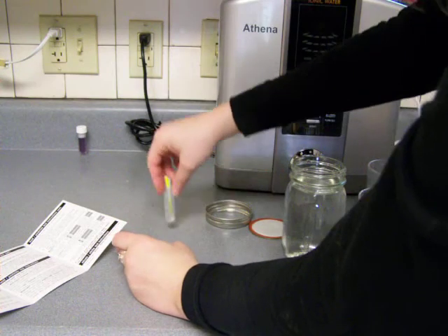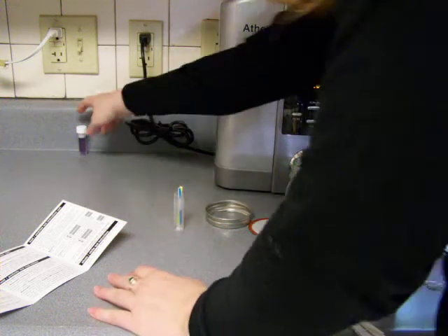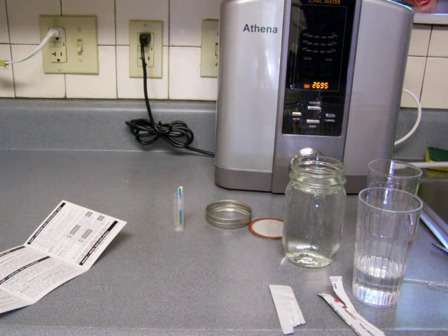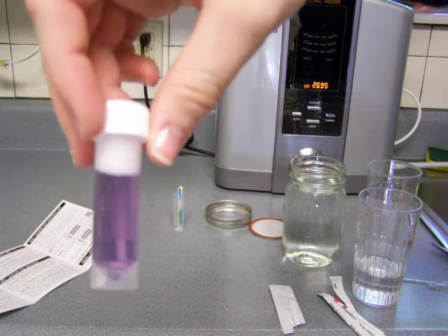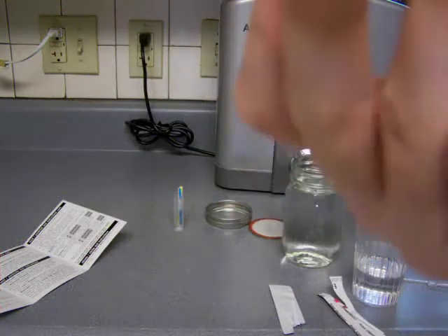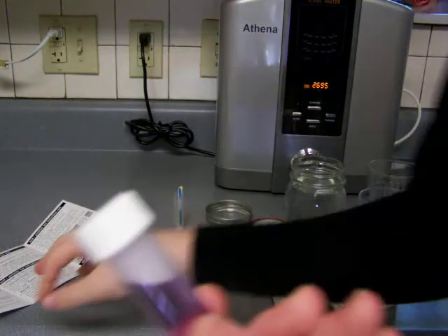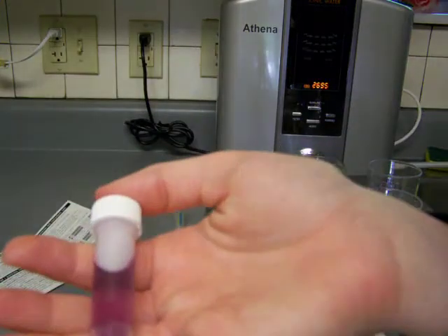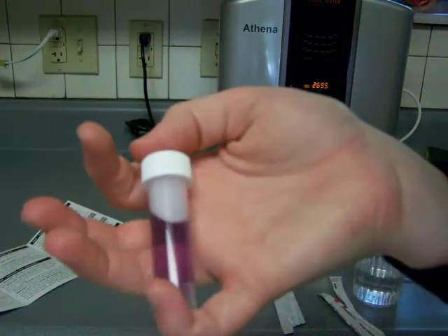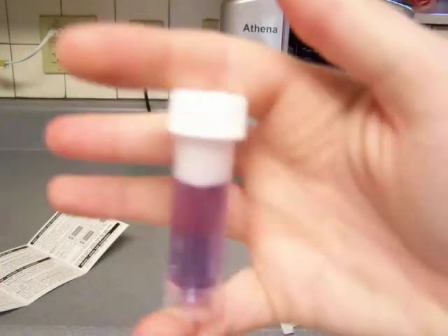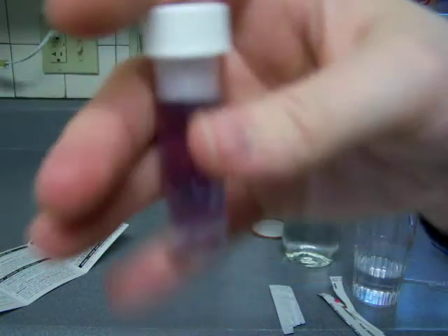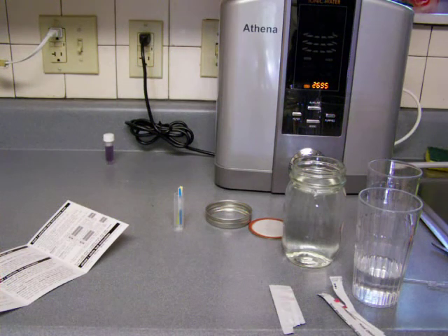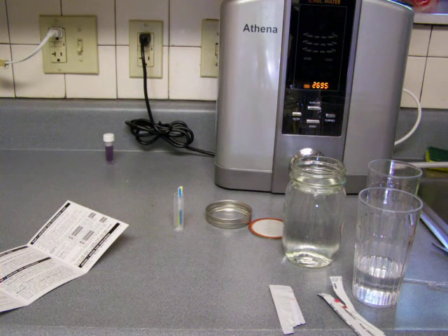And then I'm not really sure what letting this sit for a day is, but I will let you know in the blog. This is the bacteria. But it's purple right now. So I don't know. It says let sit for 48 hours. That's ridiculous. But anyway, it's purple, which is a negative result. But I don't know if letting it sit for 48 hours isn't going to change the color. So I will let you know in the blog if that changes or not. And that's all.